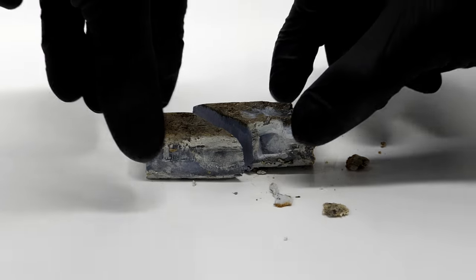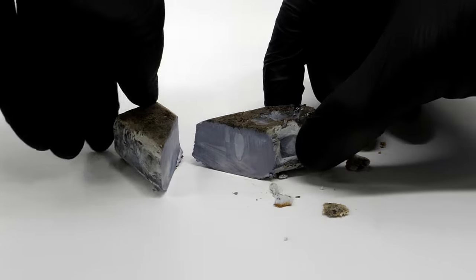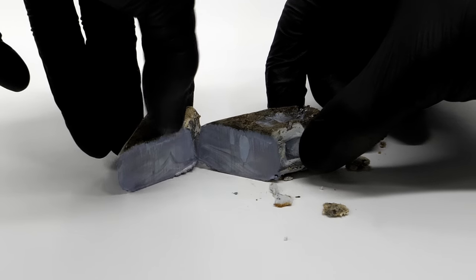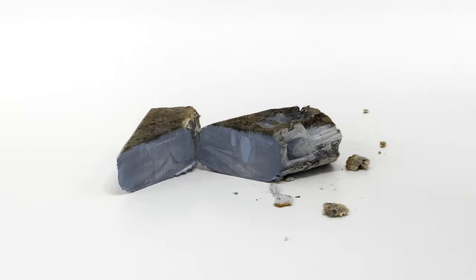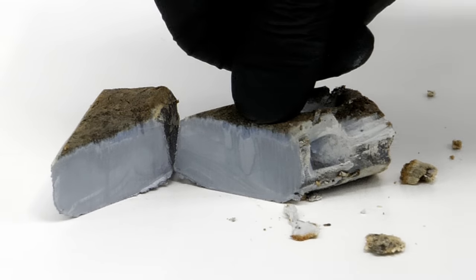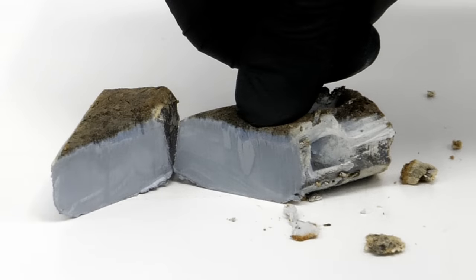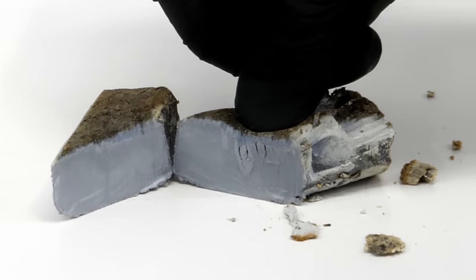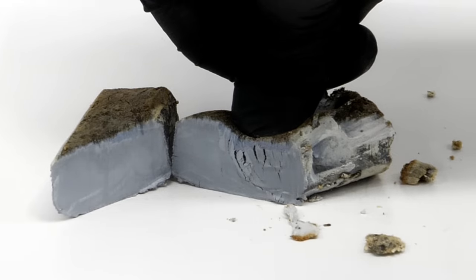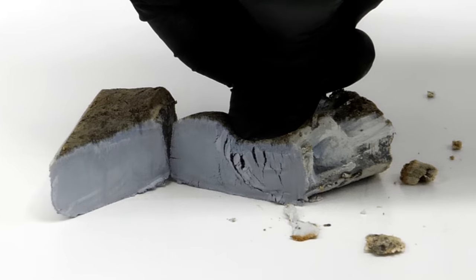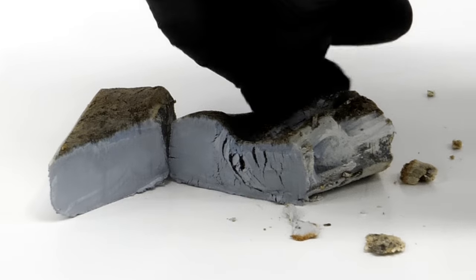Inside, it's supposed to be a nice and shiny metal, but it tarnishes almost immediately when it touches air. It's also soft enough to just squish it with my finger, and it kind of felt like pushing on weird butter.